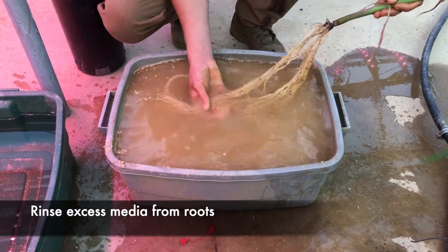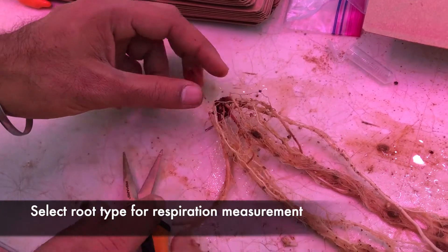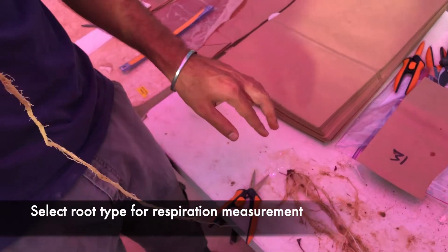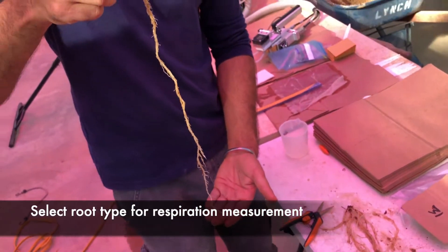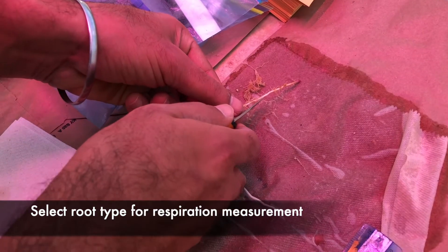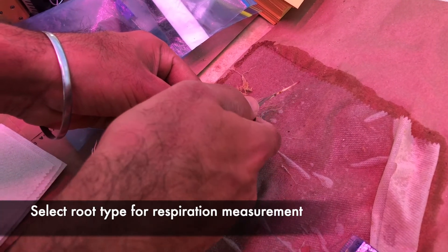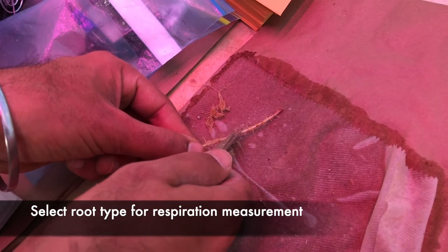Next, we sample the root system with a sharp set of pruners and select a representative root for our measurement. The decision of where to sample in the root system will be dependent upon the aims of each study. For this work, we are interested in determining the respiration of axial roots only, so we are removing the lateral roots with pruners prior to our measurement.